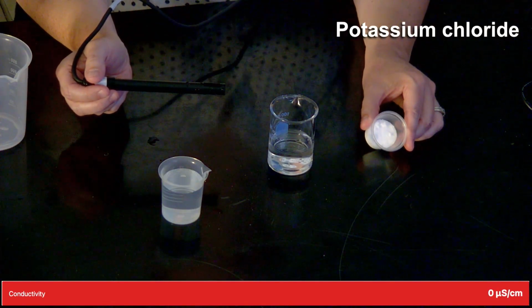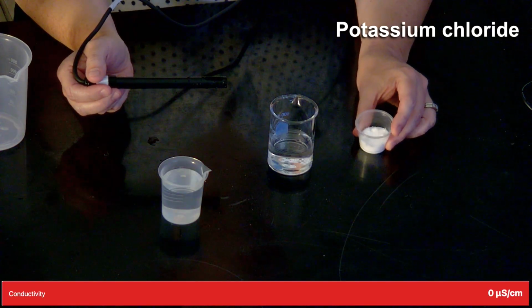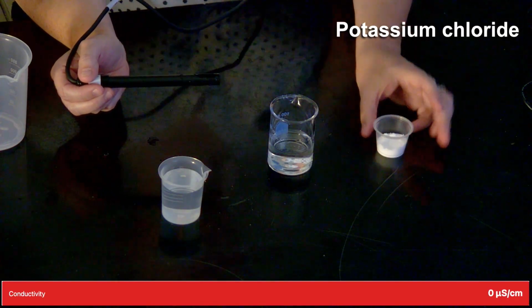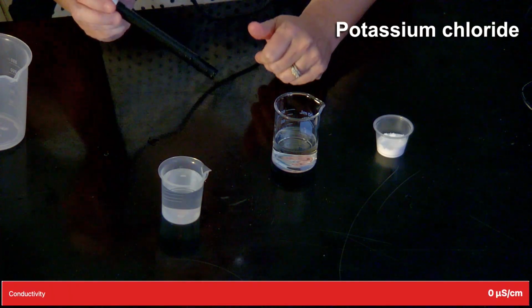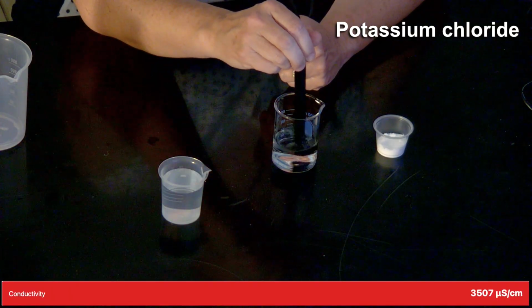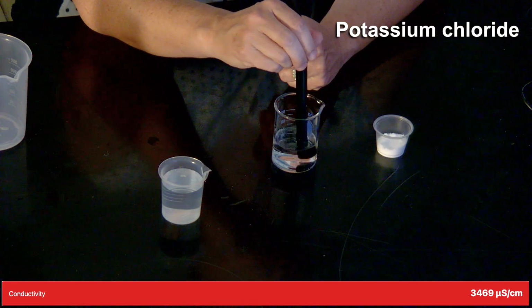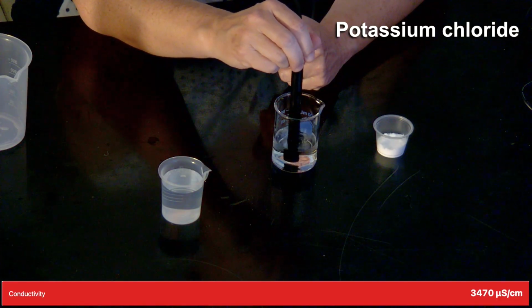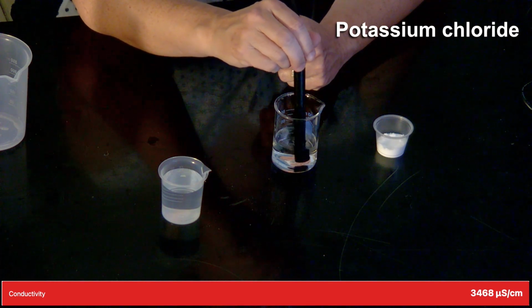We'll begin with our first substance, potassium chloride. And as you recall, it is a white granular substance. And I have some already added here to my container of water. And so I'll be inserting the probe, and we will be watching the meter in the bottom right corner of your screen. And then you'll indicate on your data table whether it is or is not conductive.